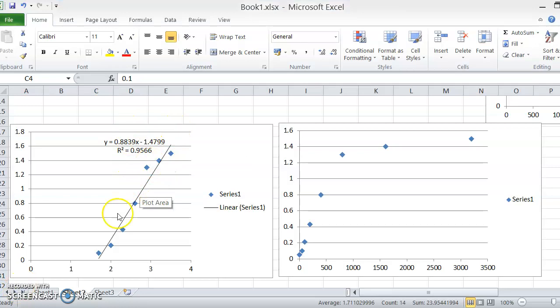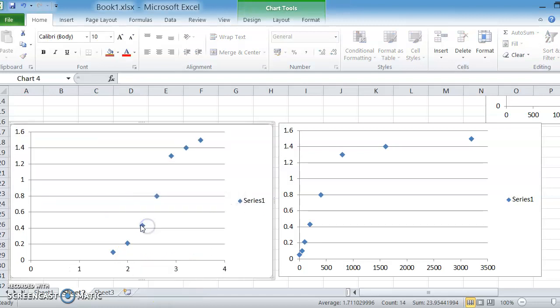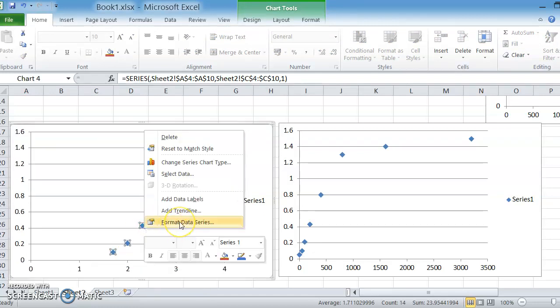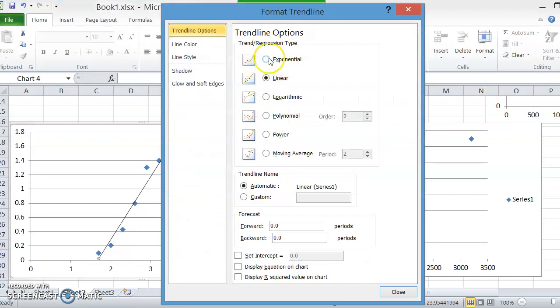Now I've plotted my formula for this graph, and all you need to do is right click on your graph, add a trend line, and you can put various ones on. If you think it's exponential, you can put one on there. If you think it should be linear, and if you transform something from an exponential to this sort of linear plot, you should be able to put a straight line through that data. So let's just pretend that my data is better than it is and put a nice straight line through it. Display the equation on the chart, display the R squared on the chart.